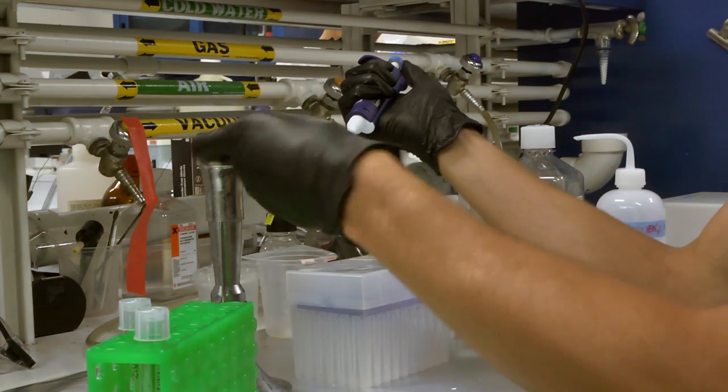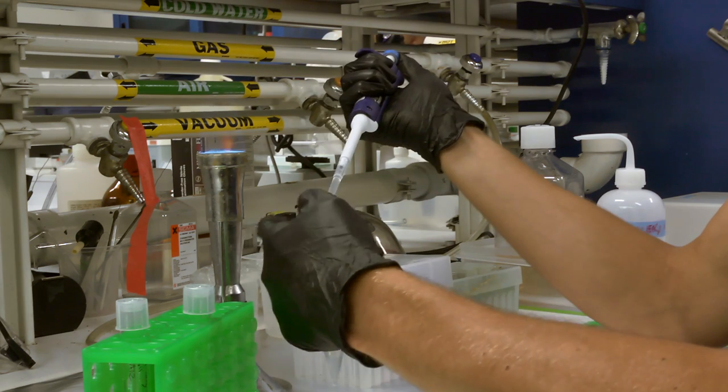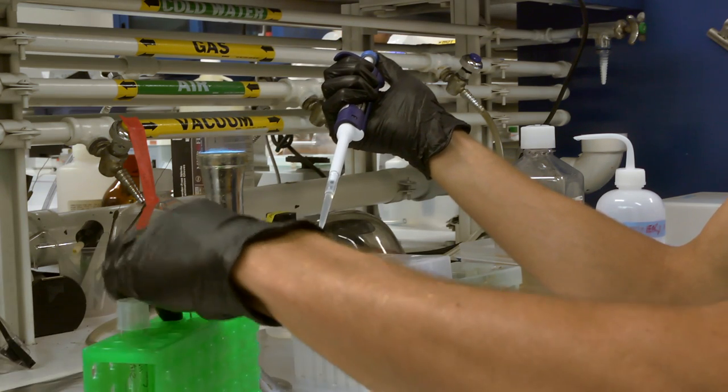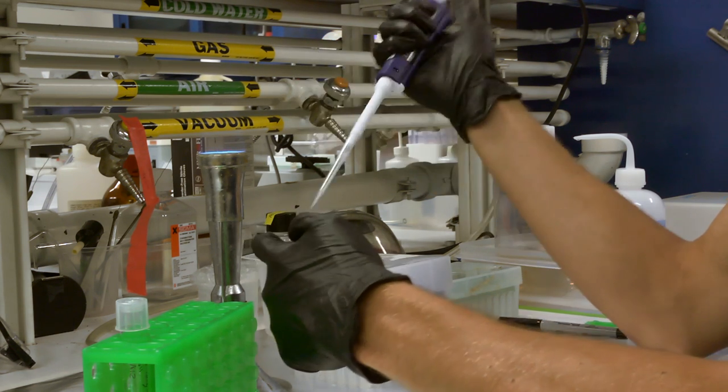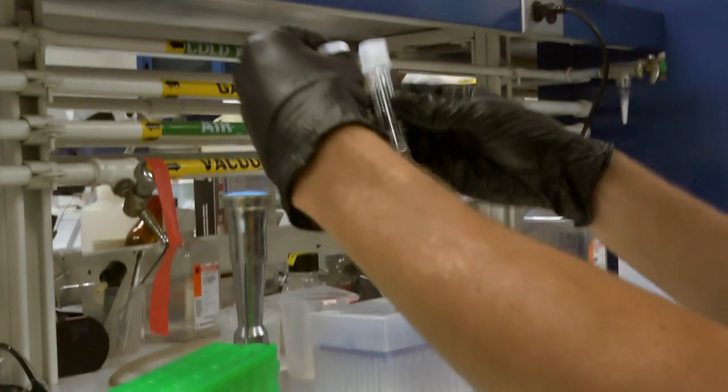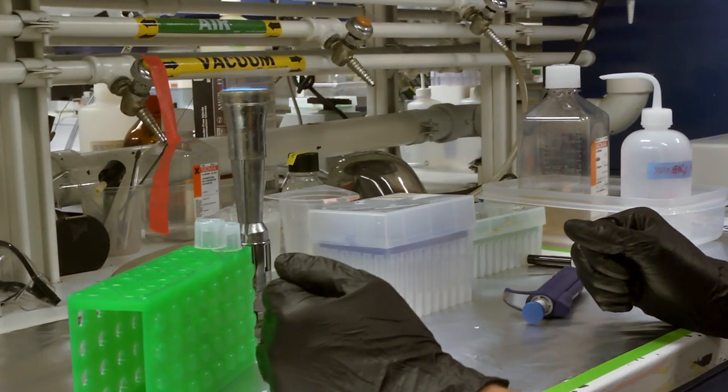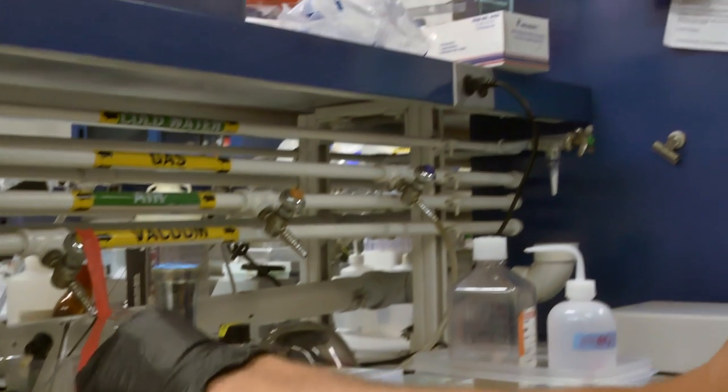So far I'm using all the same stuff, so I'm just reusing this pipette tip, but actually I just touched this one in my fingertips, so I'm going to discard that and get a new one here and draw that again. Luckily I've got a little extra. I'm going to be very careful about where your fingers and hands are on here. Trying to keep things sterile. Okay. So I can just discard that now because it's pretty much empty. Got my tip waste over there. Got that. Okay. So I've got just two milliliters in the bottom of each of these. And the other thing I'm going to need to add in here is neomycin, which is the antibiotic so that I know an extra barrier to contamination. But I actually have that in a freezer over in the other room, so I'm going to go get that and I'll be right back. Let's just turn off the flame here.